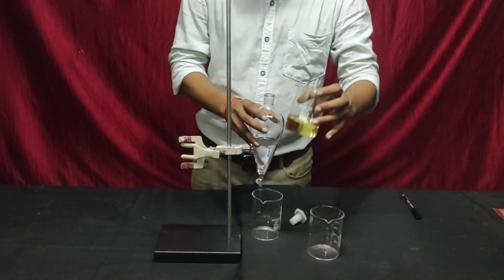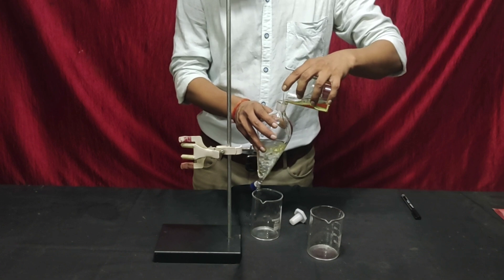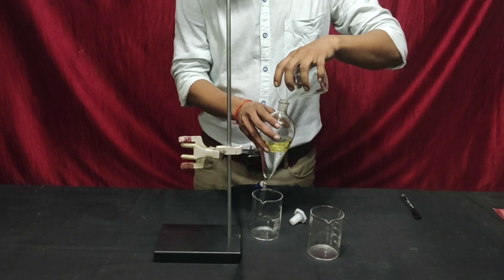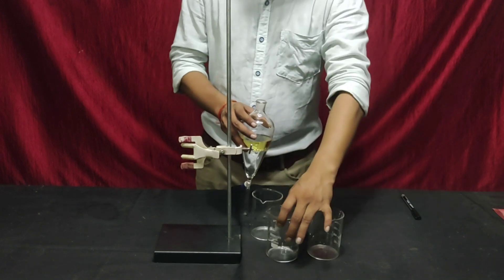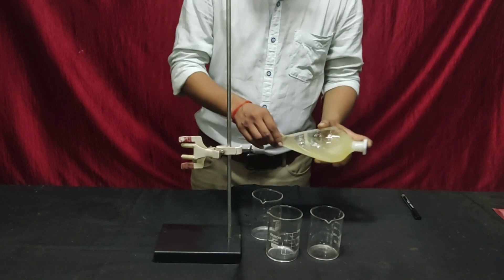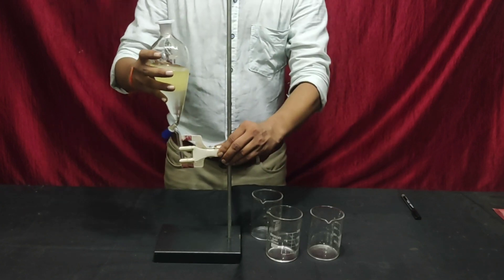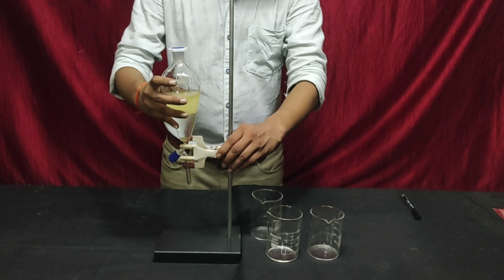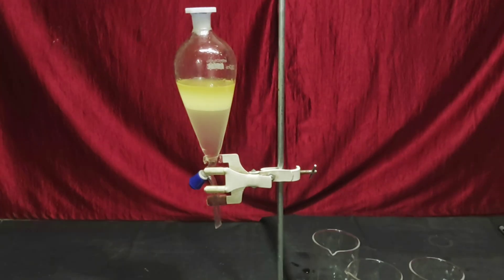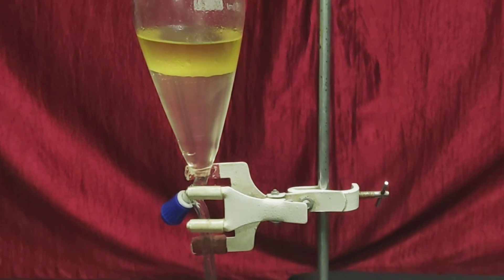Now mix the oil in the separating funnel. Close the mouth of the separating funnel with the cork and mix it well. Now leave it for some time until two distinct layers are seen. As you can see, two distinct layers of liquid are now visible.